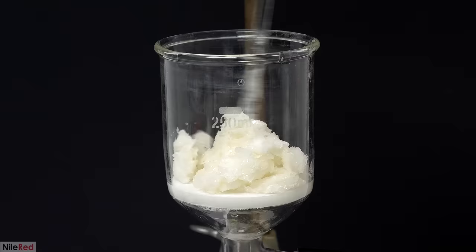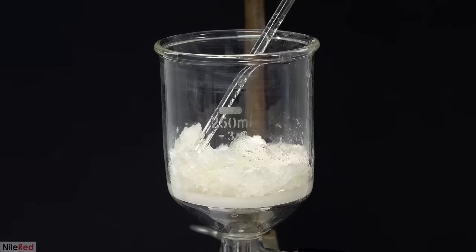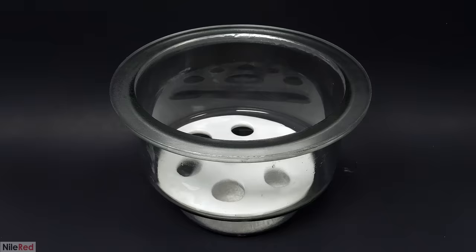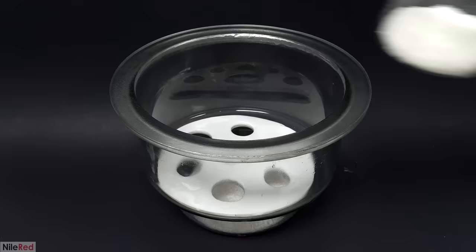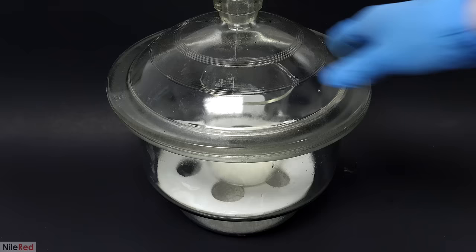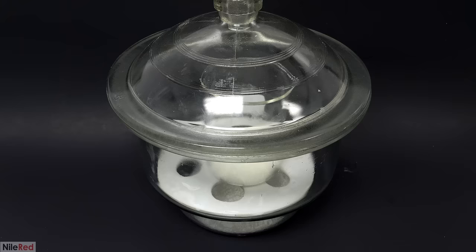Like before, I turned on the vacuum pump and I pulled away as much of the solvent as possible. Then I washed the beaker and the crystals with a small amount of ice cold ethanol. I left the pump on for about 20 minutes, but the crystals were still quite wet. So to get it as dry as possible, I transferred it back to a beaker and I put it in a vacuum desiccator. I filled the bottom of the desiccator with calcium chloride, which can form a complex with both water and ethanol and should speed up the process. I pulled nearly a full vacuum on it, closed the valve at the top, and I let it sit for about a day or so. Then I took it out, and this time it was definitely a lot drier.